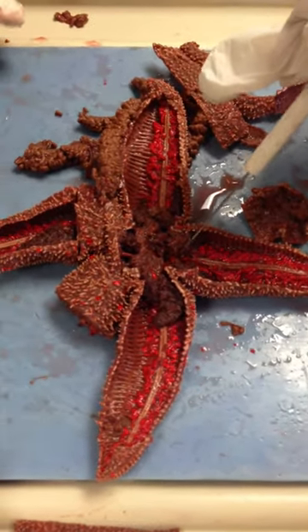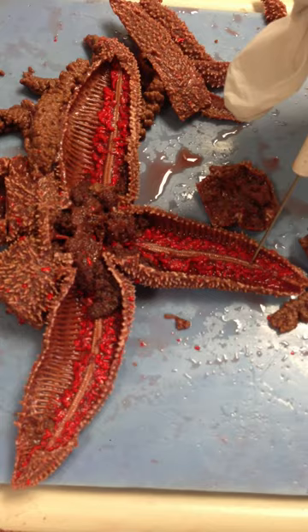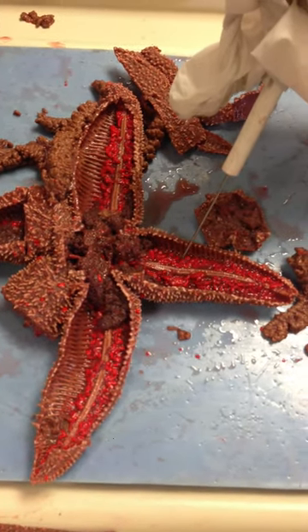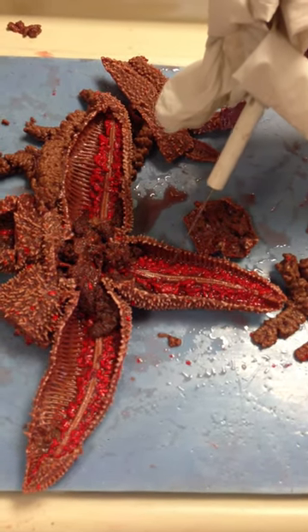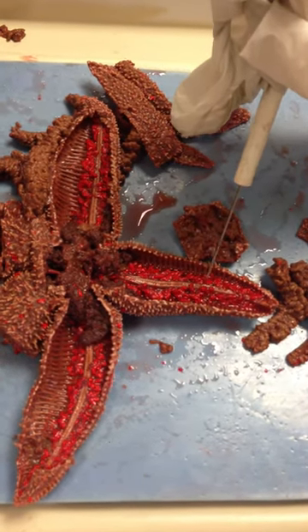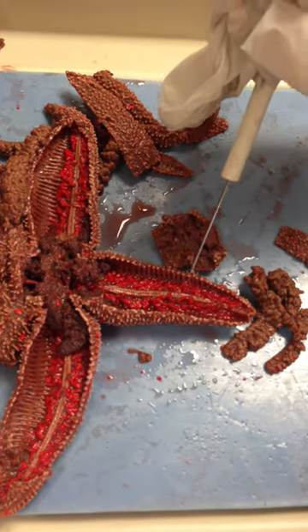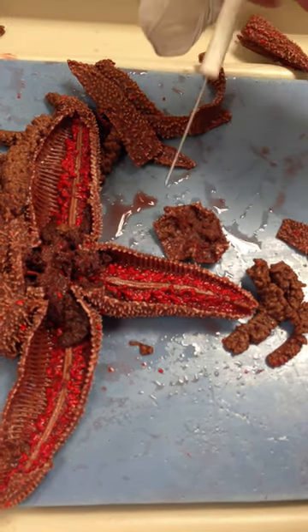Going back to the water vascular system — just recapping: madreporite to stone canal, stone canal to ring canal, ring canal to radial canal. The radial canal has lateral canals, and remember that canal means like a waterway. It's going to exit out the sides here, and it attaches to all these red structures. These red structures are known as ampullae, which are muscular sacs of the organism. These also aid in locomotion attached to the tube feet, so the organism can either move or attach onto some sort of prey and pry it open, such as a clam.